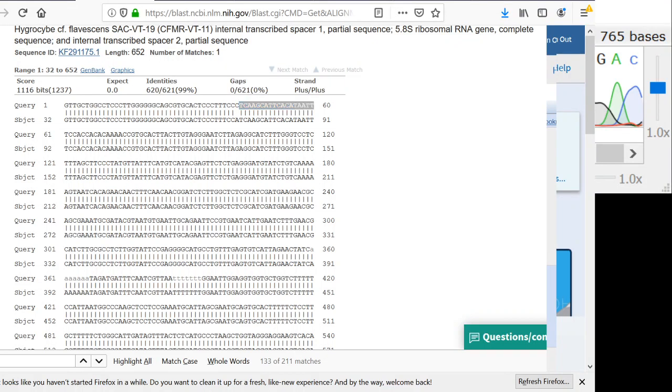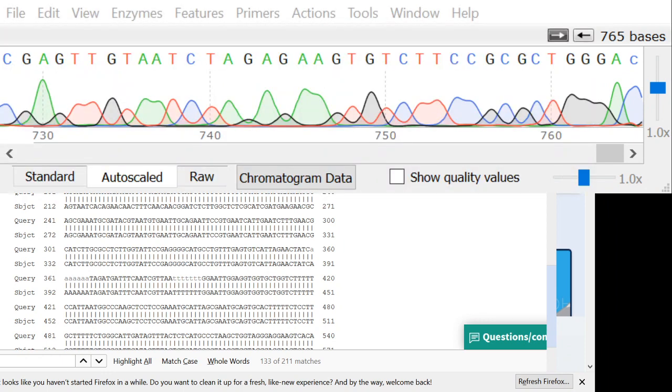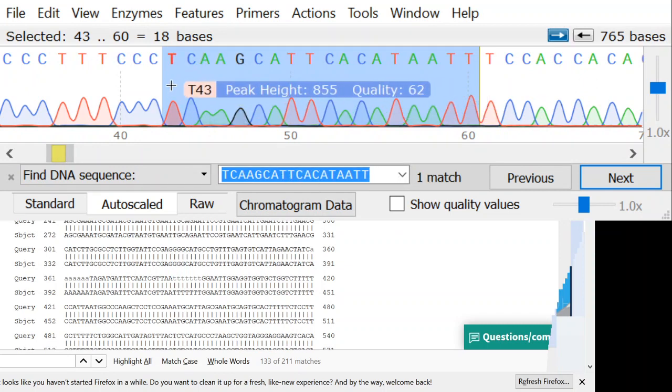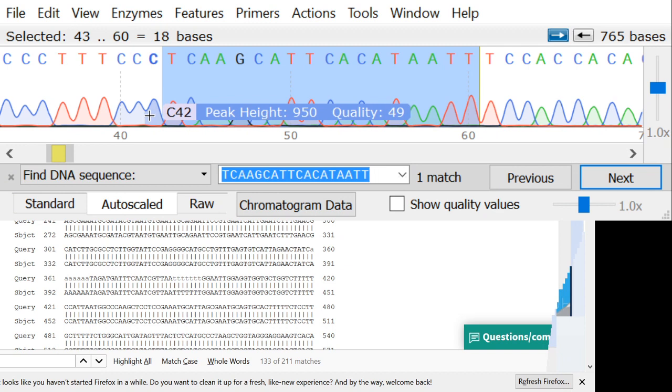So going back to SnapGene, we just hit Control F to find, and what I did is I copied the sequence right after the part where there was a difference. So I'll hit Control F to find, hit paste, and here it is. This is what I searched for. So right here, this C is the base that was different, and you can see the C is a really good read. There's no problems here. What I was looking for is, you saw in the alignment that I got a C where they have an A. So I was thinking that maybe right here there would be a C and an A on top of each other, and that would indicate there was some kind of problem, some kind of error. But that's not what I'm seeing. What I'm seeing is a really good solid C there with no noise, nothing funny about the shape at all. And that means that that's a good read.